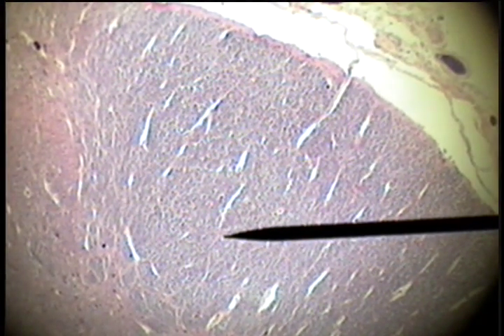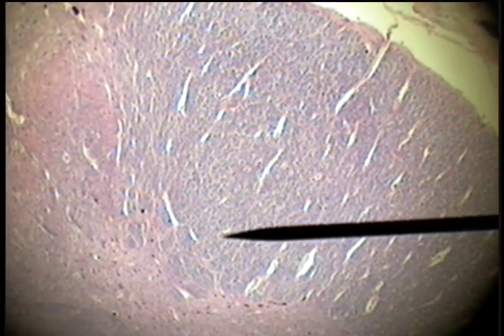If we look at the cord, we can see a difference in the color of the tissue here. This is white matter and consists mostly of fibers — nerve fibers. This slightly eosinophilic or pinkish area consists mostly of nerve cells.